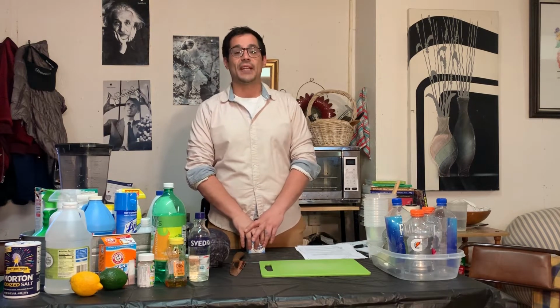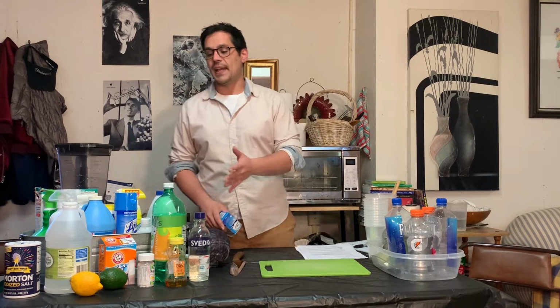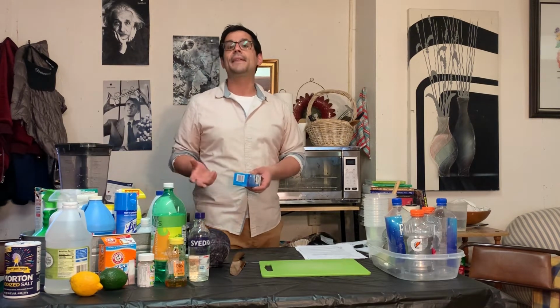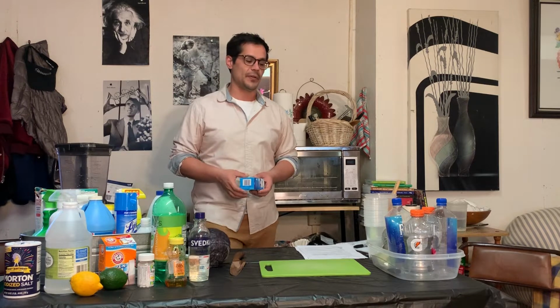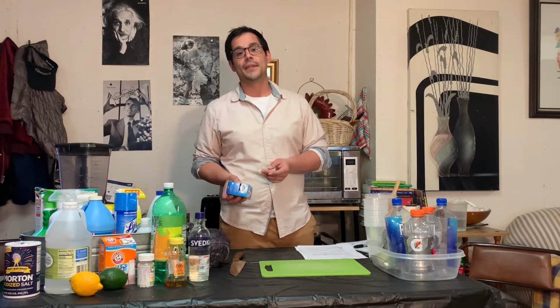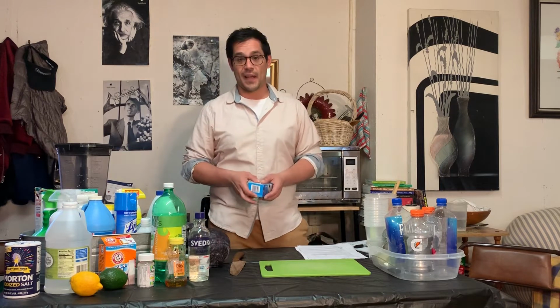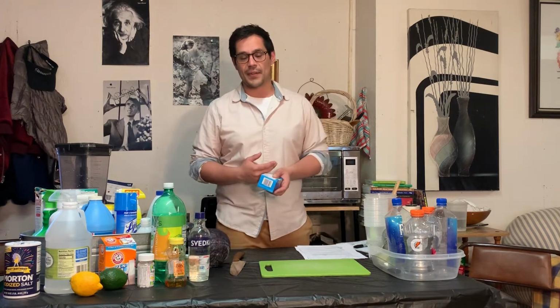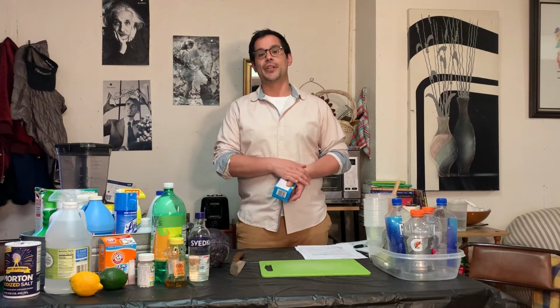When we're doing pH, we're looking at the concentration of hydrogen ions. So if the solution turns red, that means a large presence of hydrogen ions are present, making it acidic, which we can relate to what we know from lecture. If it's something basic with a lack of hydrogen ions, seeing more hydroxide ions, or basic ions rather, we're going to be seeing the blue color changing.